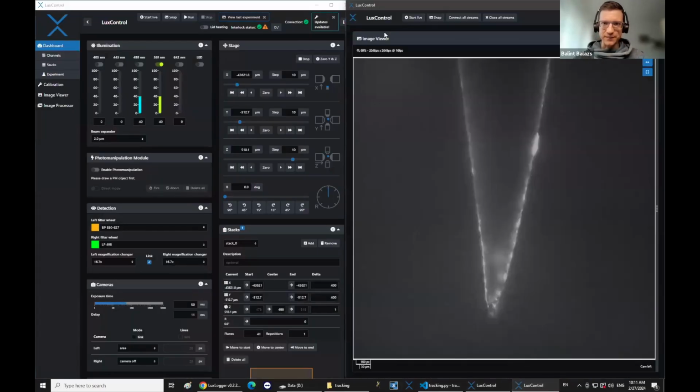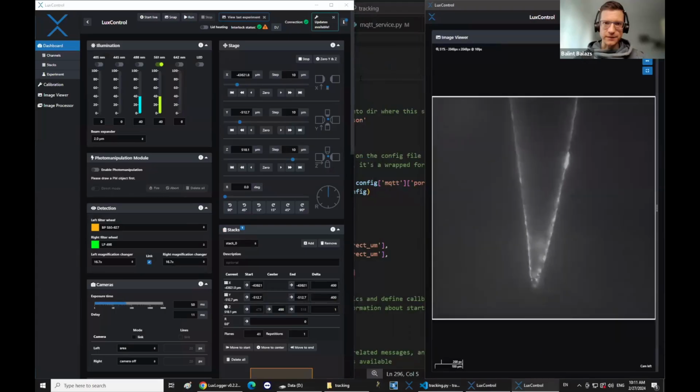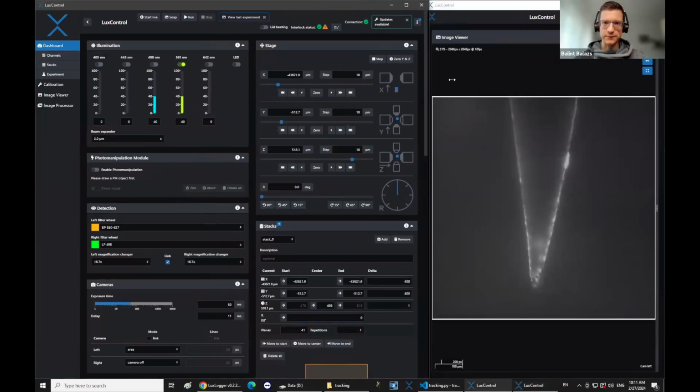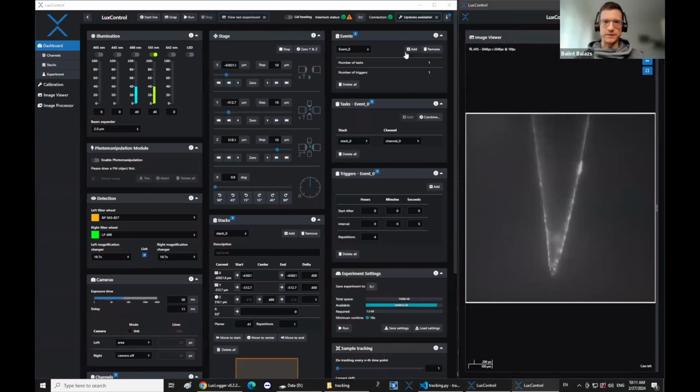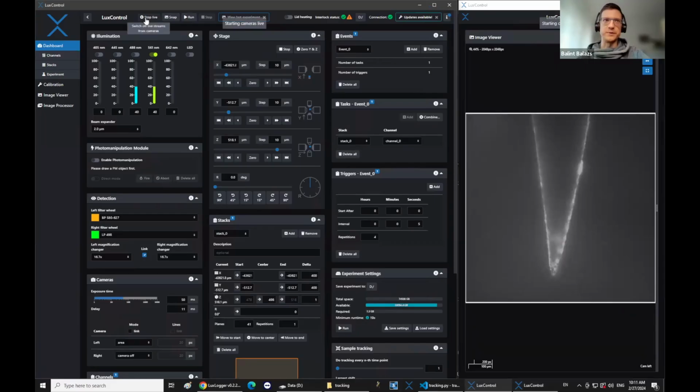Okay, so here we are. I just arranged the screen a little bit. It's a little bit cramped at the moment because it's on my laptop screen. Normally we have a huge 4K screen for the microscopes, but hopefully it's visible. I just have this test sample in the microscope. It's just a needle, so nothing interesting. It will not drift at all. So you just have to believe me that the script works.